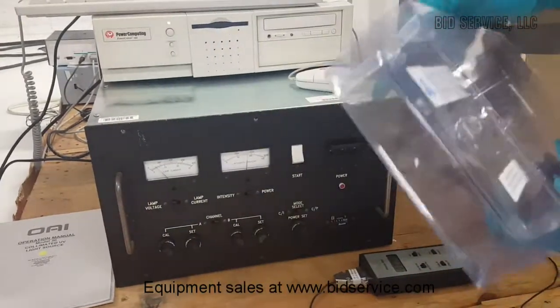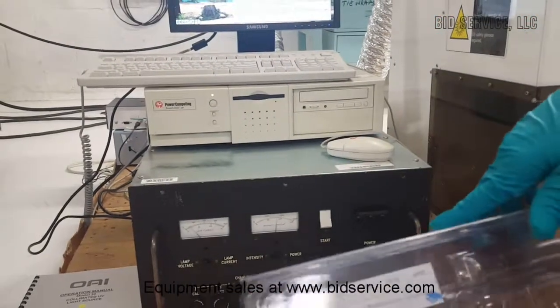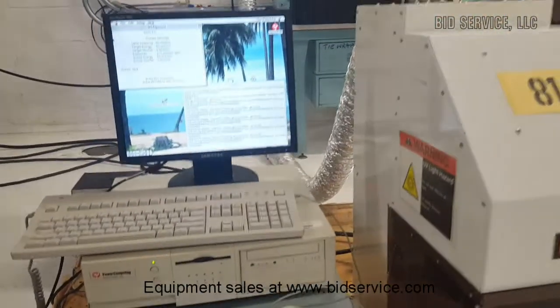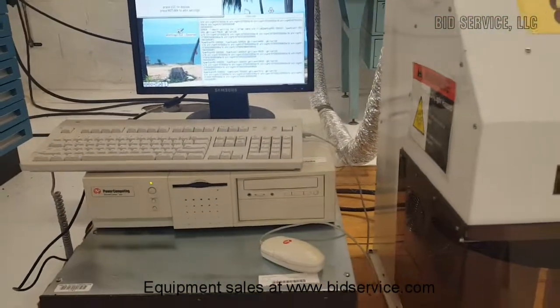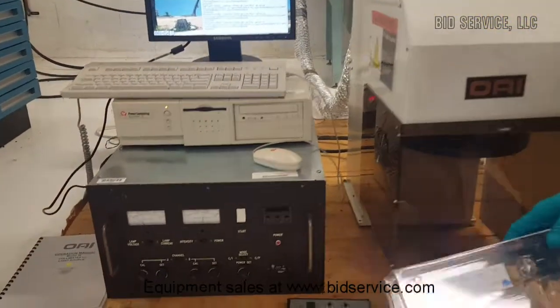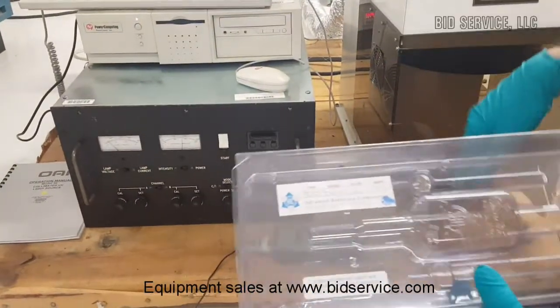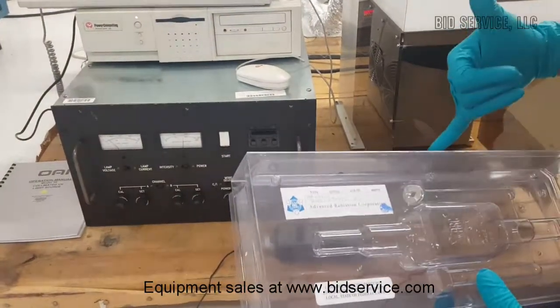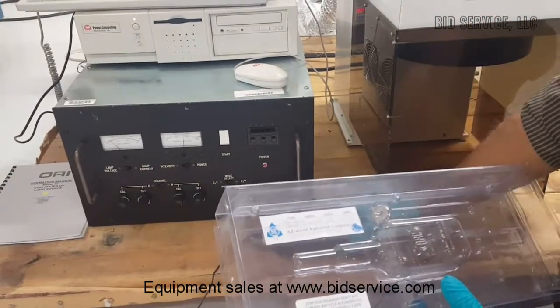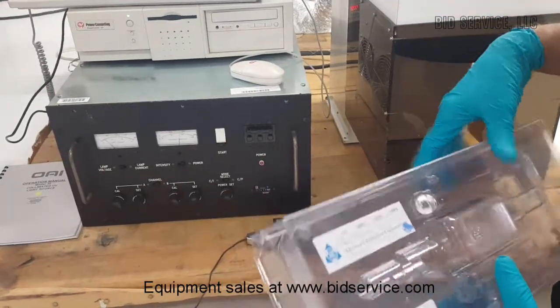The lamp has to be installed as marked on the lamp. The lamp has two electrodes, the anode and cathode, with the anode in the up position. That is, the lamp should be mounted vertically through the ellipsoidal reflector such that the anode is up and the cathode is down.